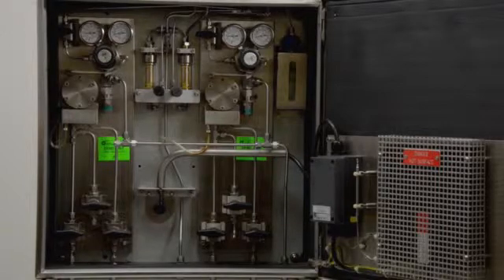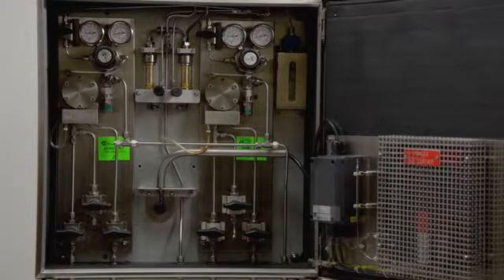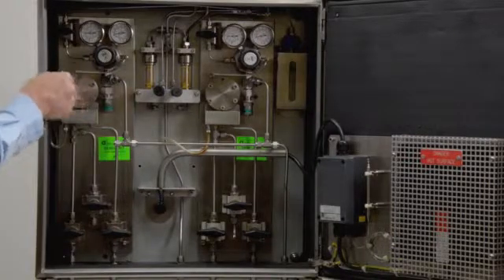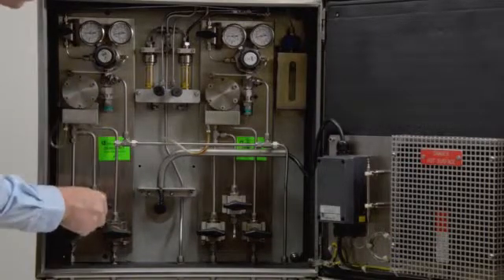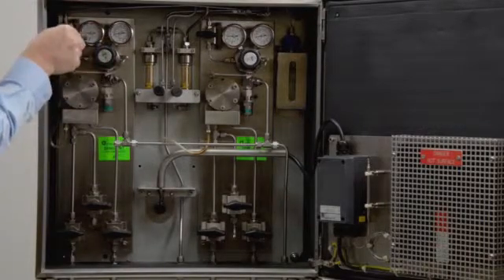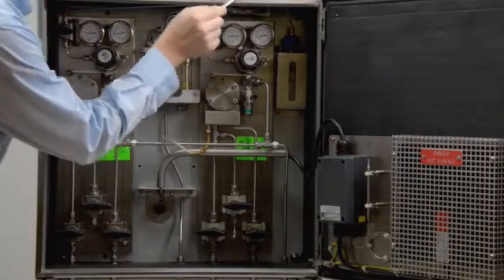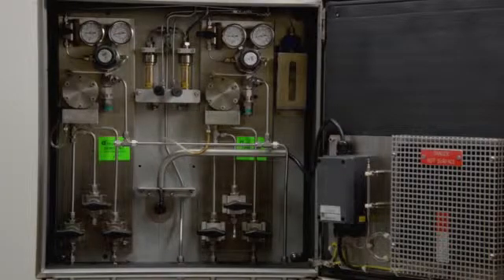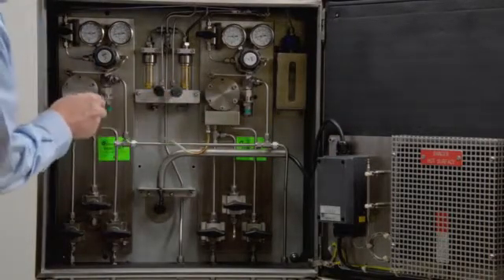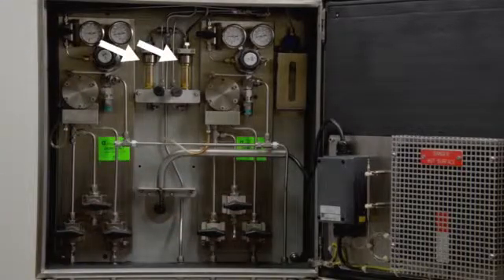A crude oil cabinet is also equipped with a heater to prevent buildup of waxes and blockage. During the test, the sample passes through a fast sample loop which contains a self-cleaning bypass filter of small volume. Before entering the measuring cell, a pressure controller regulates the sample pressure. The minimum inlet pressure required is 110 kPa. The pressure relief valve prevents overpressure. The flow can be monitored by the flow indicator.